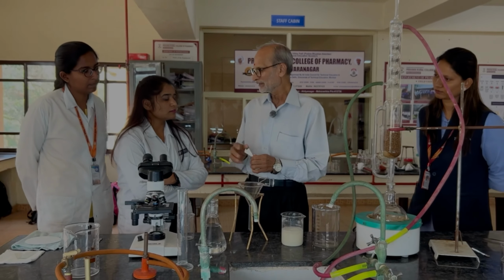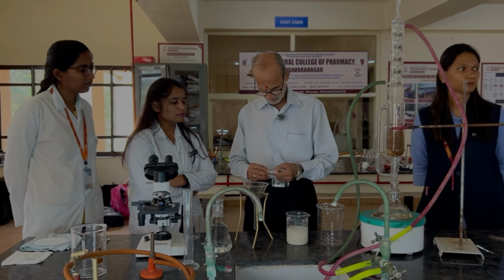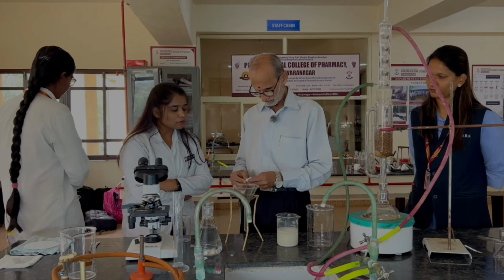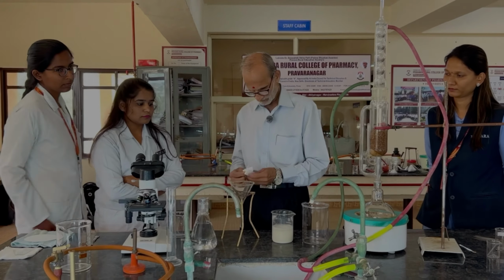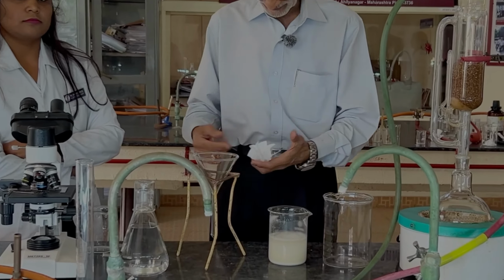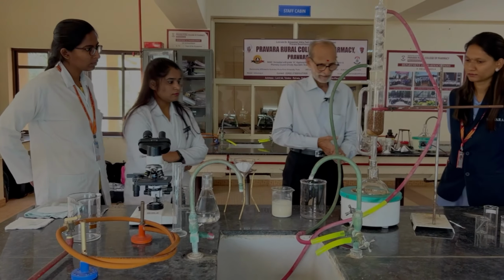In this, the full area is available for the filtration. Okay, all right. This has started.